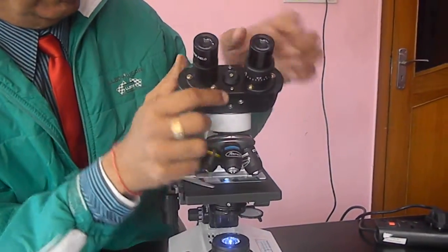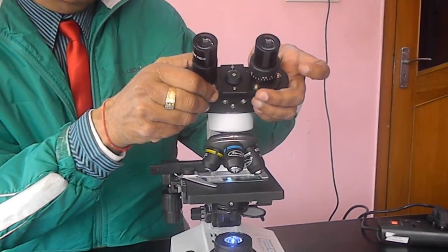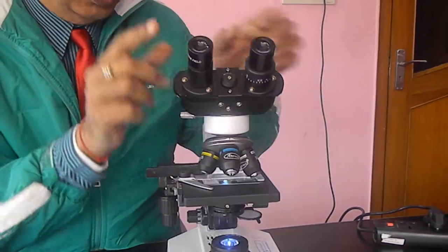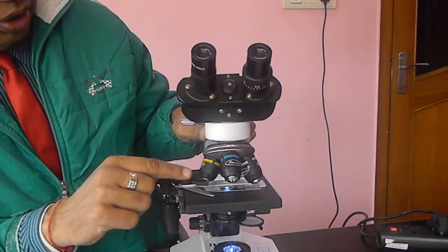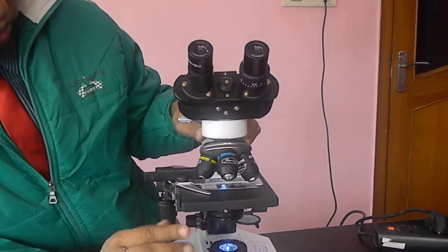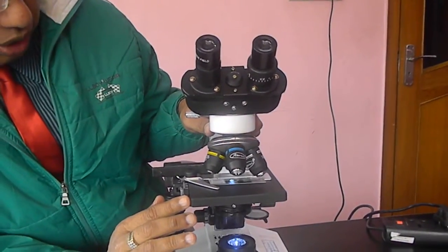There is one interpupillary distance adjustment. It depends on the distance between your two eyes. You can adjust this. First of all, let us learn the best way to understand and take the best out of it.